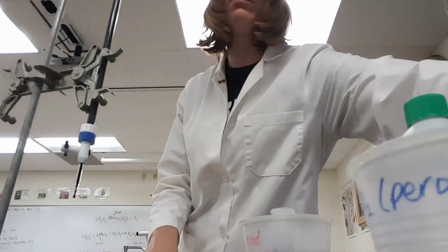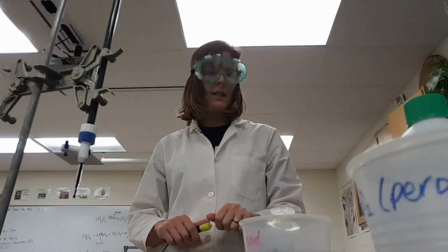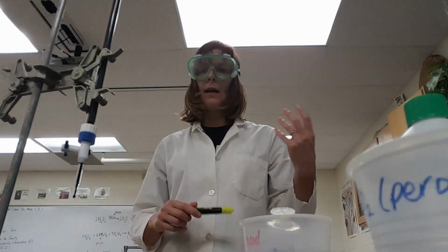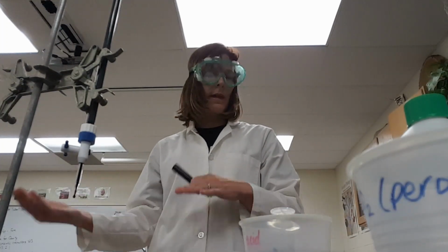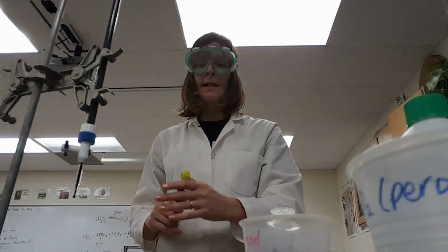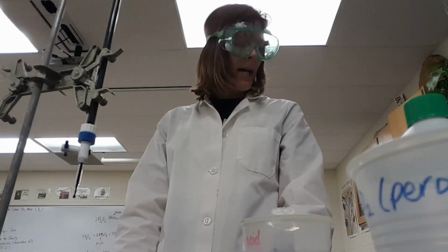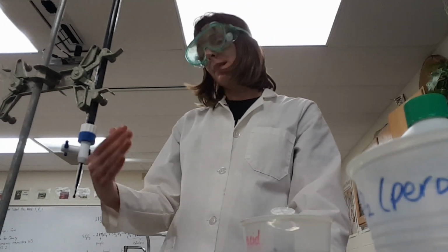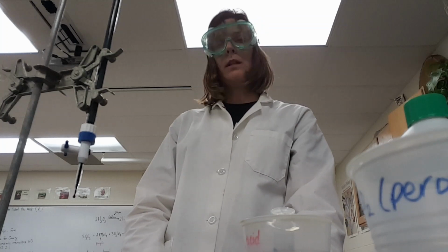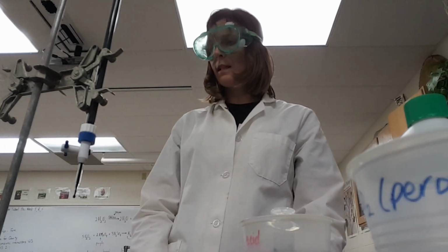Something is a little bit funky with what I did there, but nevertheless, that is how you would end up doing this titration. I should have used less when I had the enzyme present because the enzyme broke down some of the hydrogen peroxide. But that is not what I ended up seeing. So if this is my lab, I would go back and redo some of that. Of course, in my demo video, that ends up being screwed up.